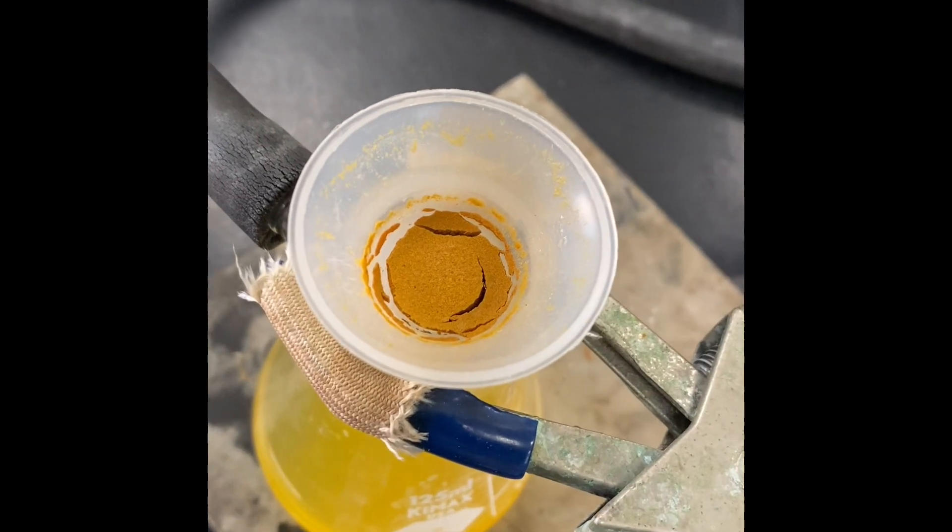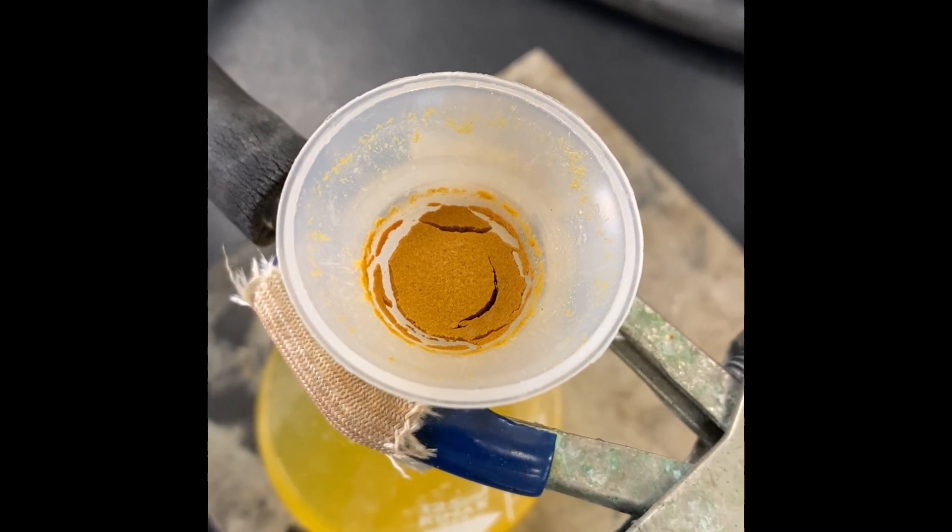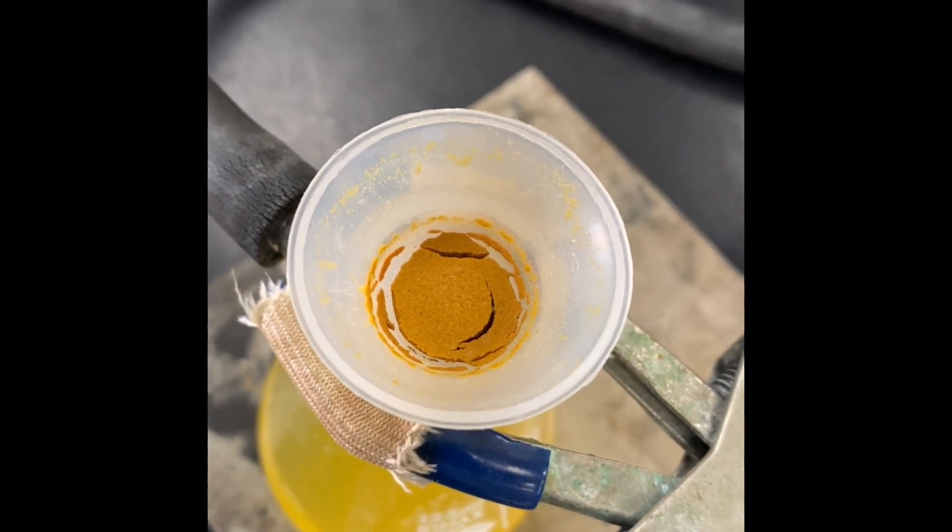After vacuum filtration, this is the product we have. This is our luminol, and now we're going to use that for the light-producing experiment.